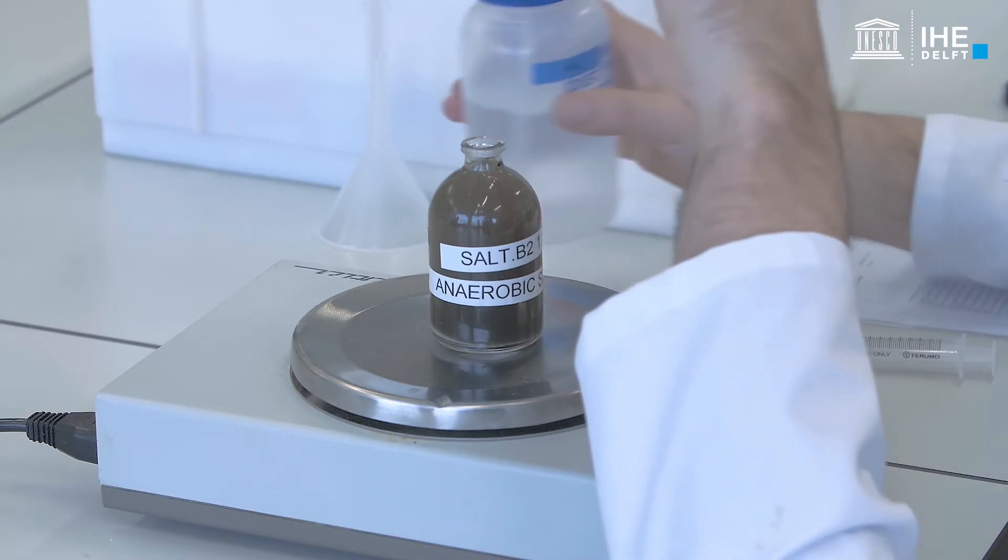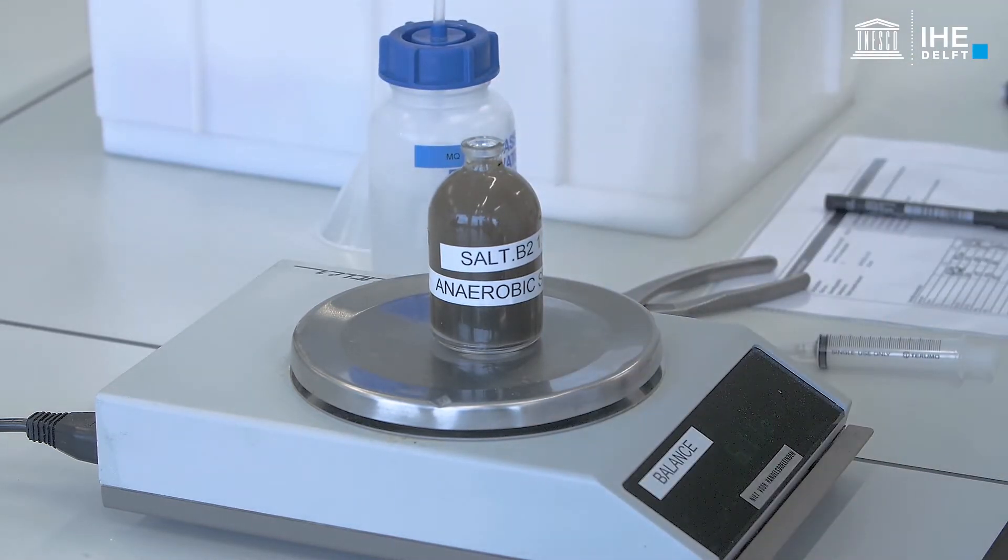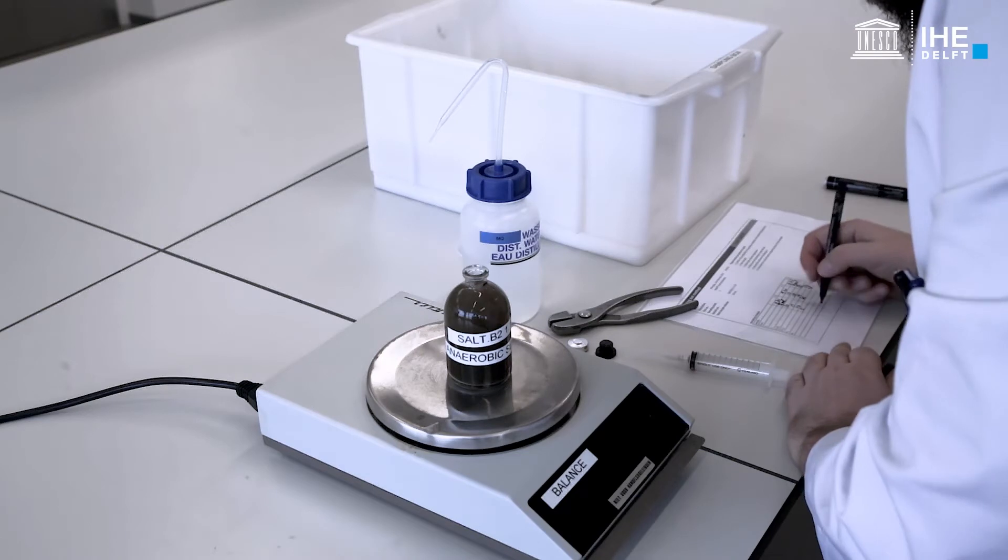Subsequently, the bottle is filled with water up to the mark of the stopper and the weight of the bottle, weight one, is also registered.